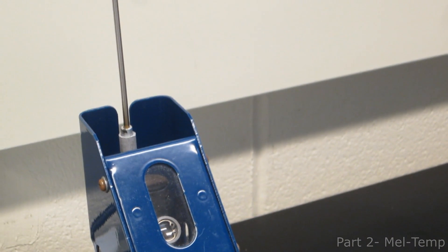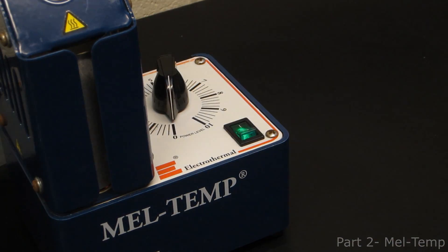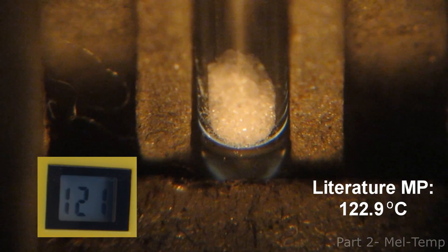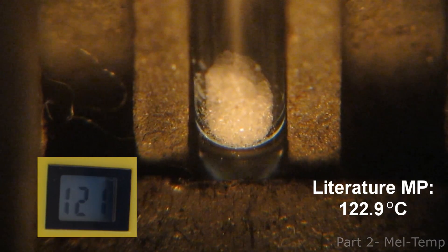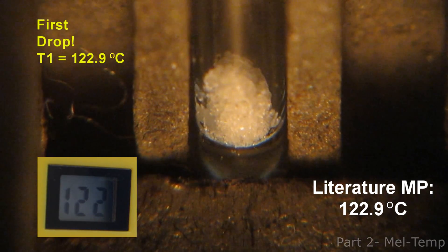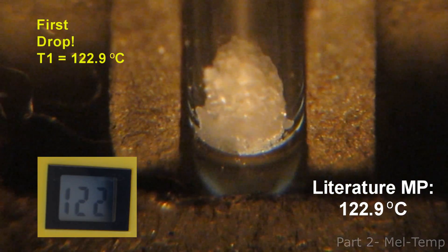Use the smallest amount that can be seen to melt. If you look closely, there are three slots in front of the thermometer compartment — load the tube into one of these slots. Turn the on-off switch to on and set the voltage control to 4. Note that the observed melting point depends on the rate of heating, because some solids can decompose or bubble before actually melting. We know the sample is actually melting when the first drop of liquid is visible. If you are heating too quickly, say at about 5 degrees per minute, you will have a broad temperature range even if the sample is pure.